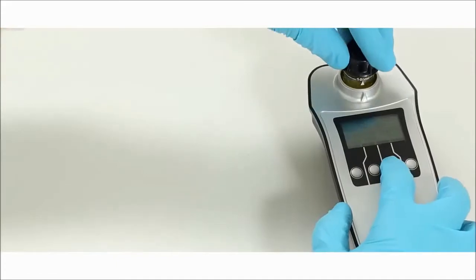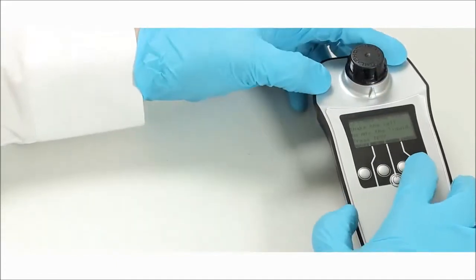Wipe the test cell clean and place back into the PrimeLab. Press test.